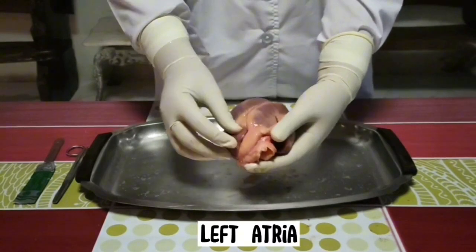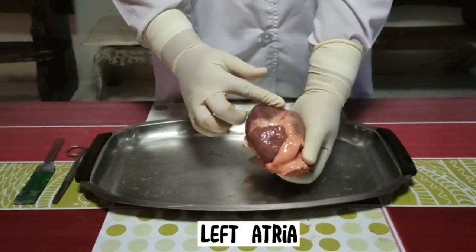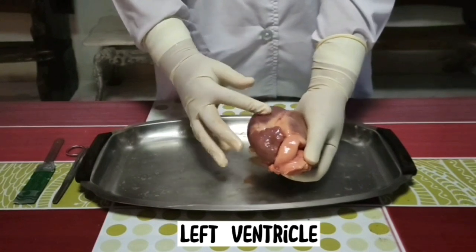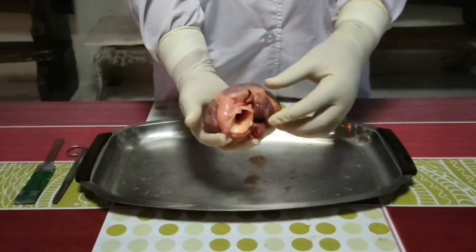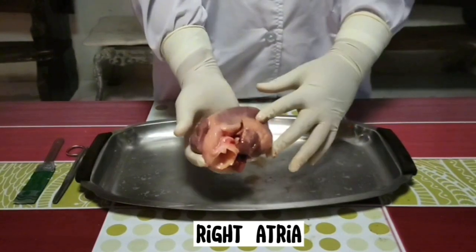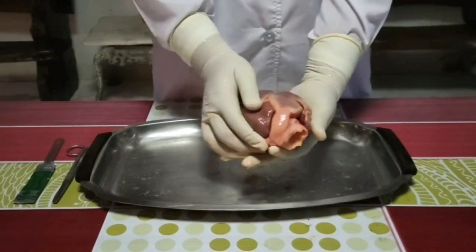This is our left atrium, upper chamber to your right. This is our left ventricle, lower chamber to your right. Right atrium, upper chamber to your left. Right ventricle, lower chamber to your left.